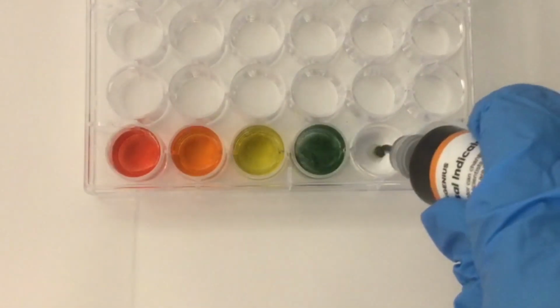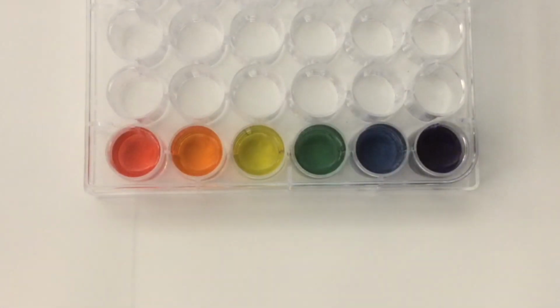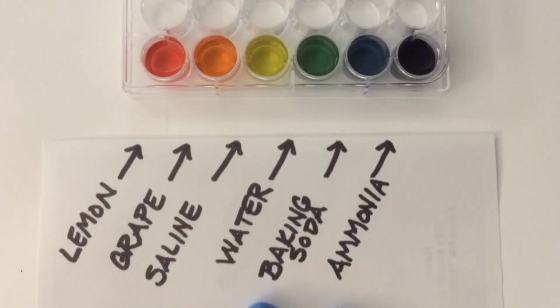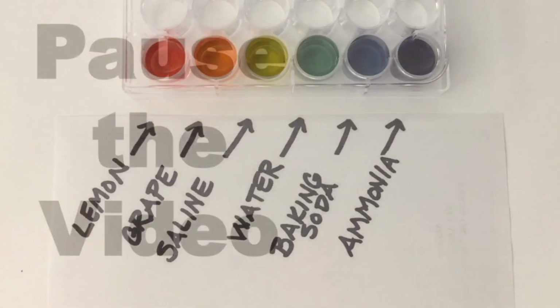The liquids are in order from left to right, from most acidic to most alkaline. And here comes the order of what they are. How did you do? Pause the video so you can complete the Part 1 analysis diagram. And when you're ready, start the video again for Part 2.